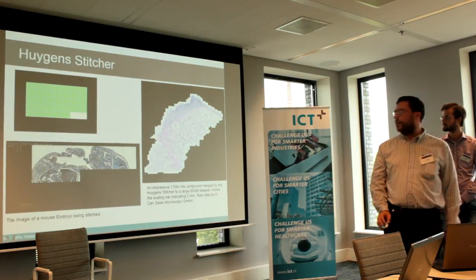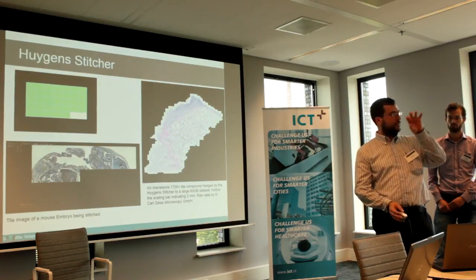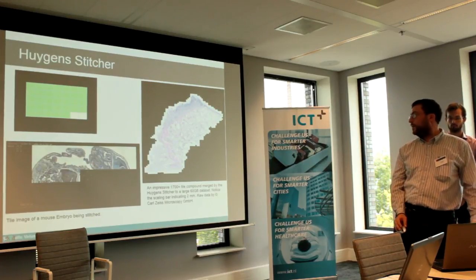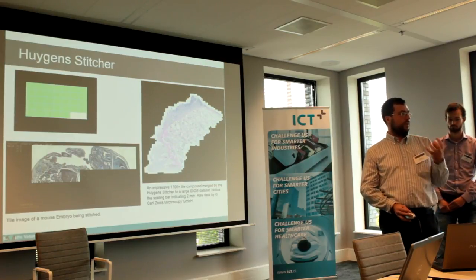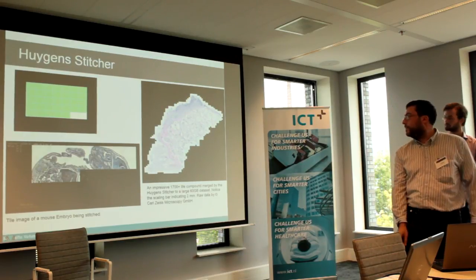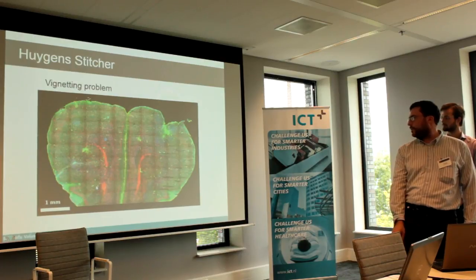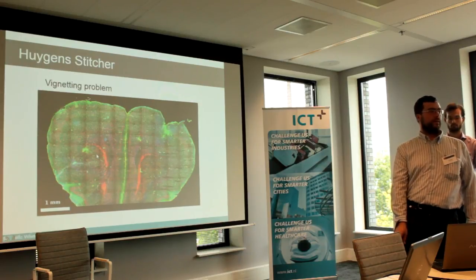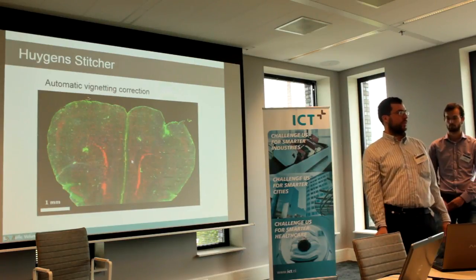The stitcher tool is quite familiar if you think about a smartphone or a compact camera, where you can take panorama pictures which are stitched together into a single picture. You may want to do that with microscopic images too, maybe in 3D. If you have a certain field of view of the microscope, you can move a stage and collect multiple images which can then be stitched together. If the homogeneity of the illumination or the data collection is not completely ideal, you can get something like this. We call it a vignetting problem, where you see the borders. And of course, then we try to correct for this kind of thing too.